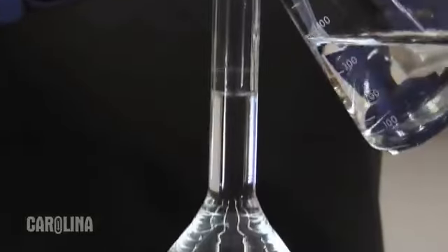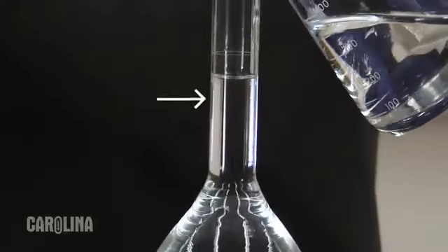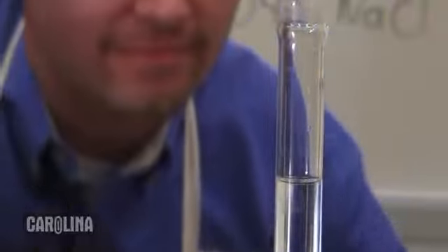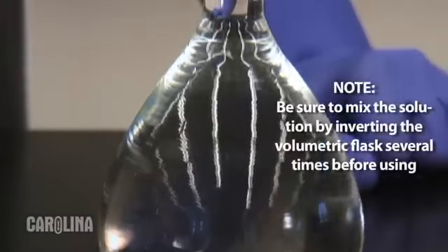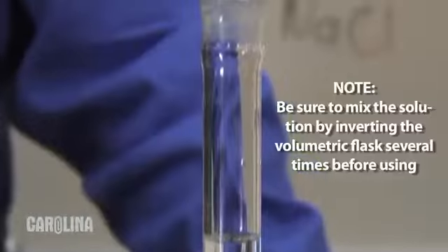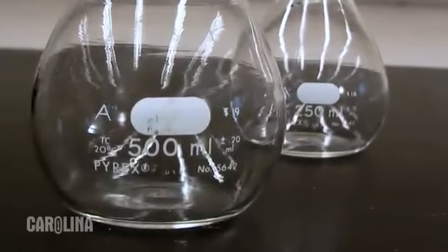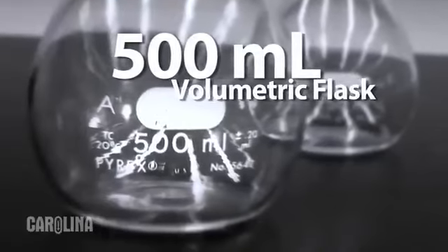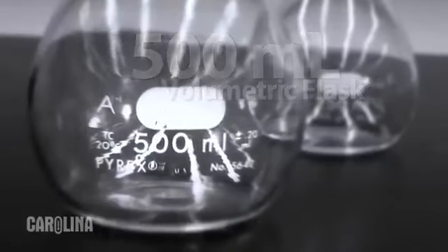Water, as a polar solvent, tends to cling to the glass walls of a flask. This phenomenon creates what is called a meniscus. The bottom of this curved meniscus should sit directly level with the line on the flask. At this point, there is exactly 500 milliliters of solution with an error of 0.2 milliliters. Different volume flasks have different error values. However, the error on a volumetric flask is much lower than any other type of glassware of similar volume.